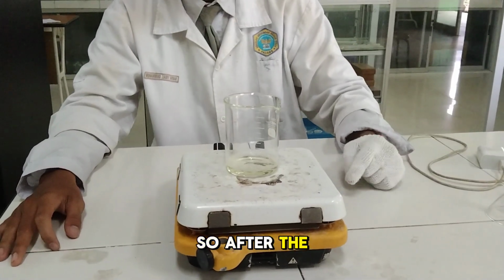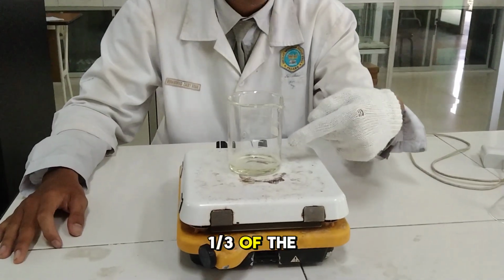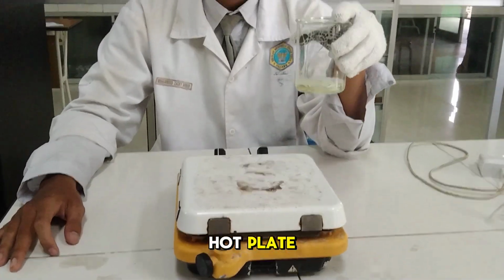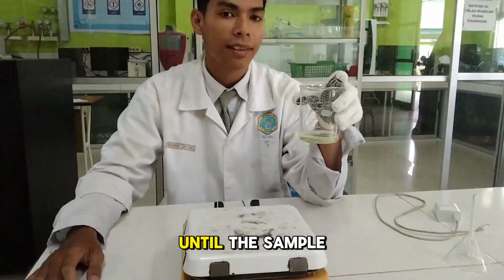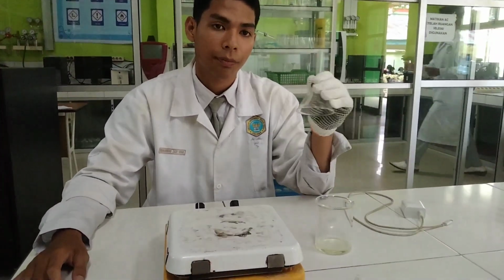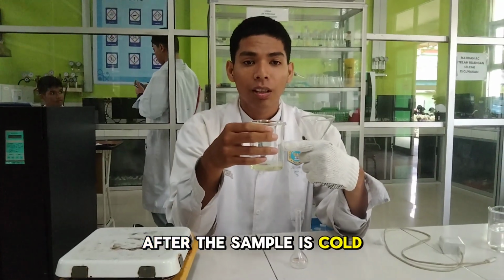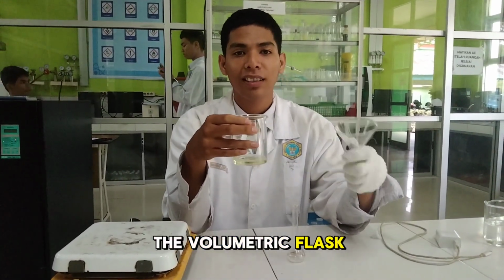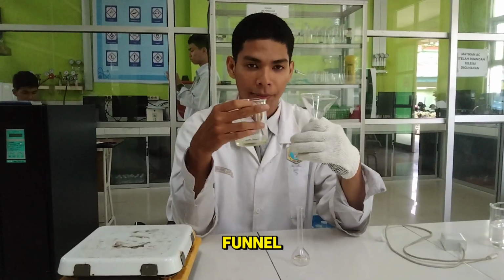After the volume is 1/3 of the original, we take the sample from the hot plate and wait until it is cold. After the sample is cold, we can pour it into the volumetric flask using this funnel, and then filter the sample.